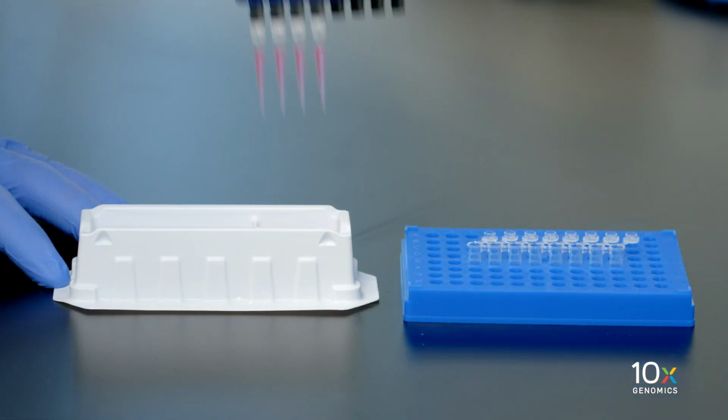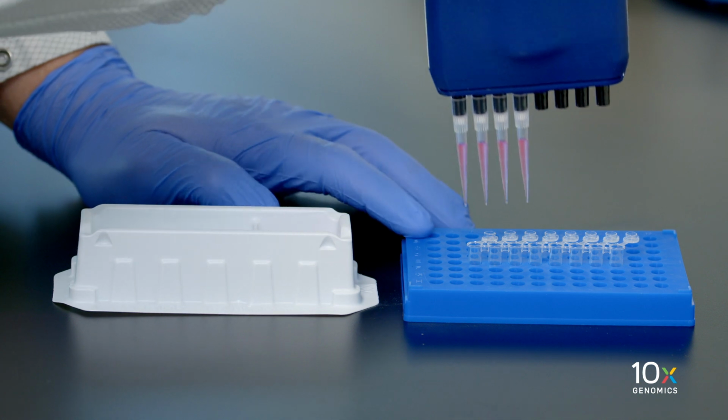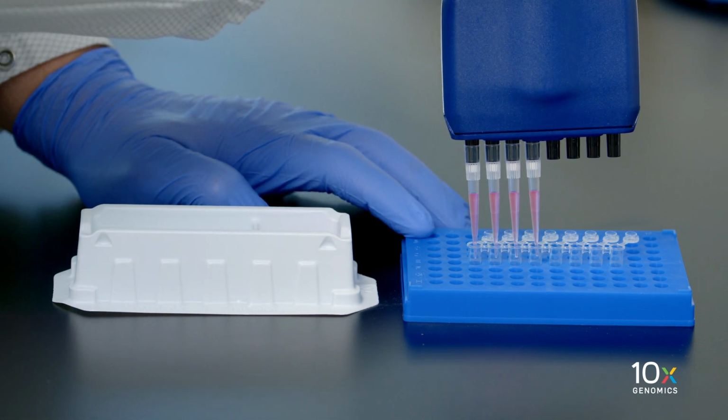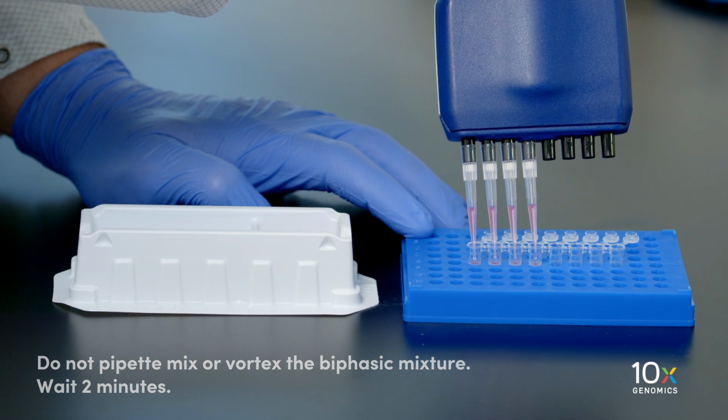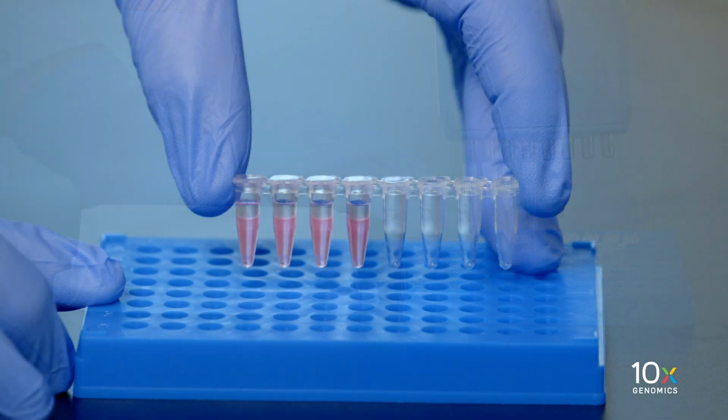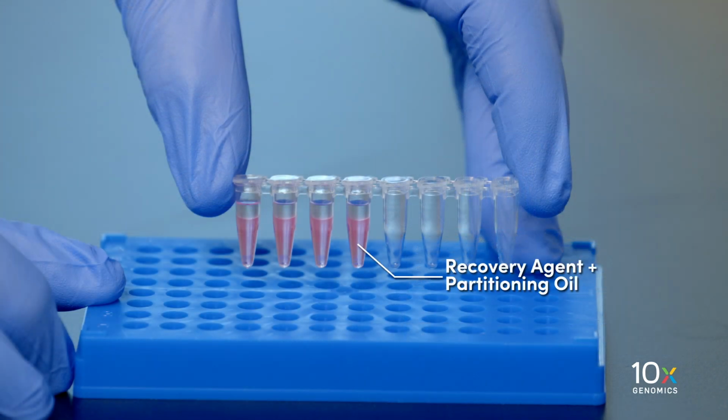First, we add 125 microliters of recovery agent to each sample at room temperature. Do not pipette mix or vortex the biphasic mixture. Wait 2 minutes. The resulting biphasic mixture contains recovery agent and partitioning oil and aqueous phase with no persisting emulsion.